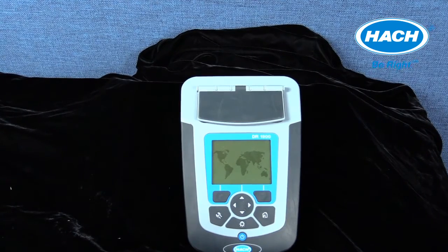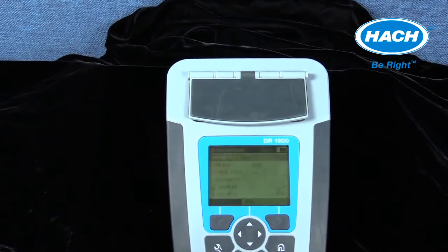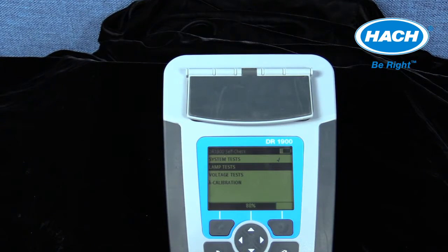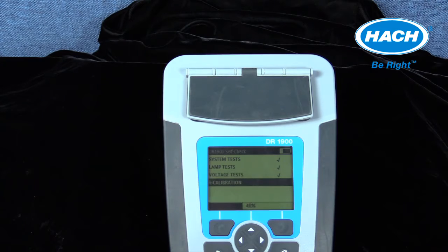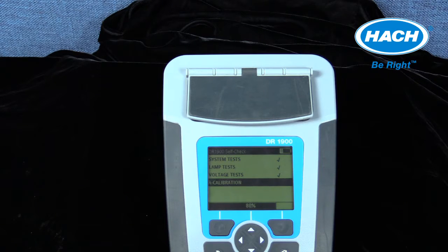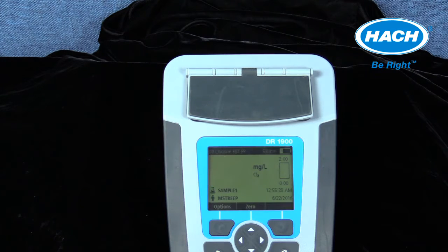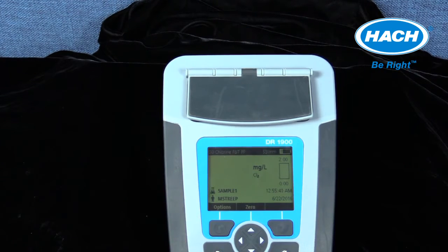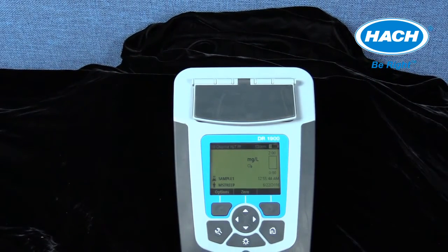The DR-1900 performs four diagnostic checks when powered on to ensure the functionality and performance of the instrument. The checks include a system test, lamp test, voltage test, and wavelength calibration check. Once the tests are completed and passed, the instrument proceeds to the measurement screen. The last stored program used will be displayed.